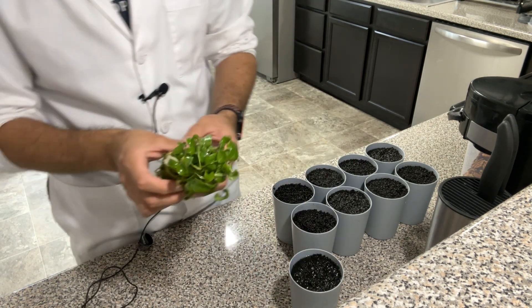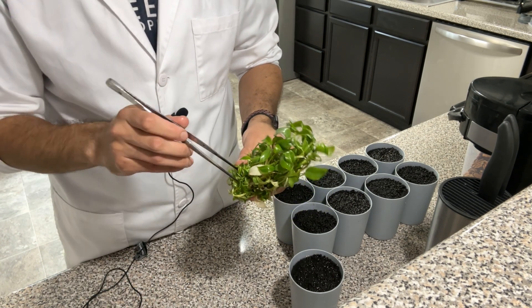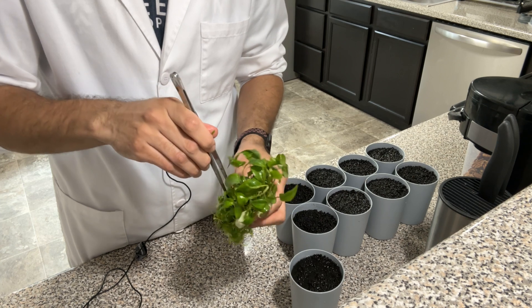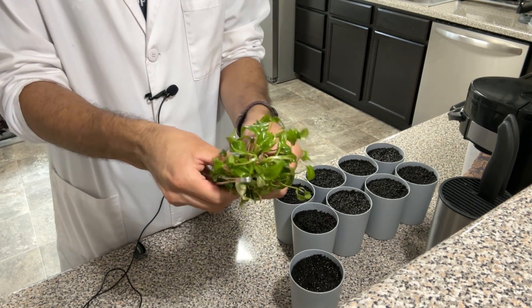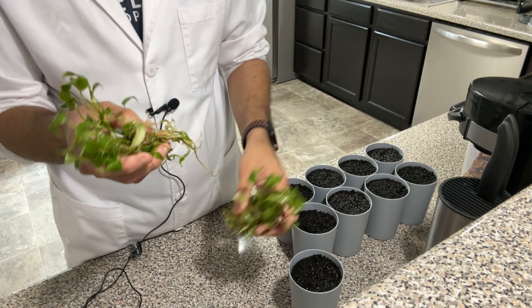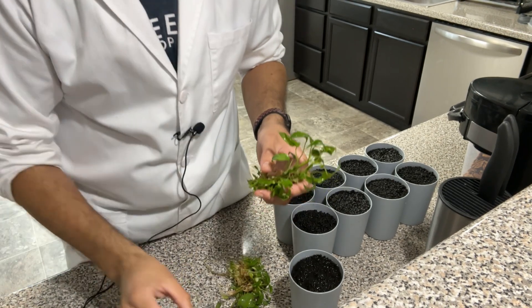From here you can either use your hands to carefully split the plants apart, or use tissue culture forceps. Let's work this out carefully — I'm probably going to rip them apart. You can see they have nice roots. These plants are Philodendron paraiso verde, which is one of the easiest plants to root, so I'm not too worried if I destroy some of the roots. I'll just set them on the counter for now.